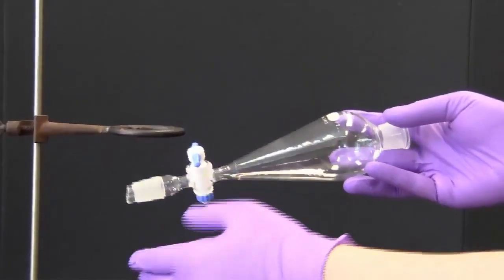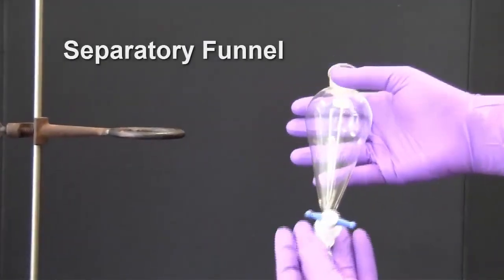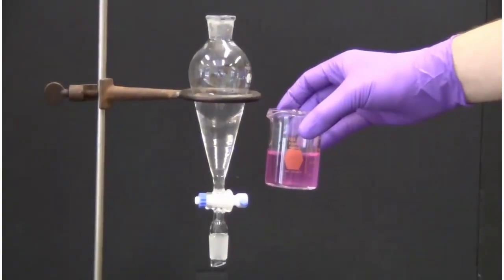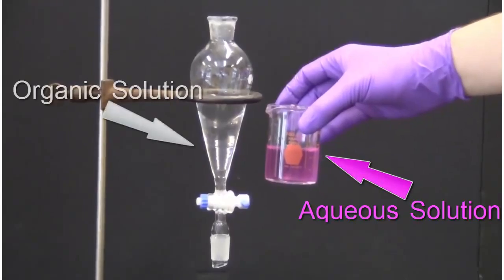To perform an extraction we will be using a separatory funnel. This technique allows us to separate the aqueous layer from the organic layer.